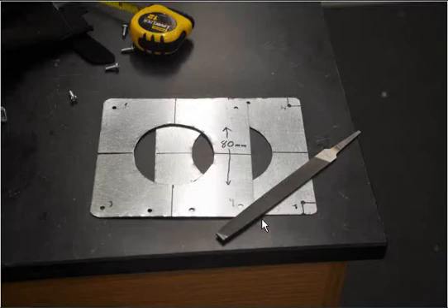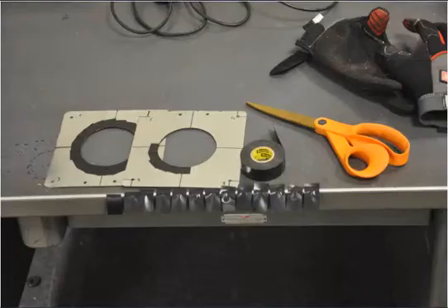Then I'm going to file down the edges and try to reduce any burrs or sharpness, and round the corners with some tin snips so they don't scrape people or cut them up too much.